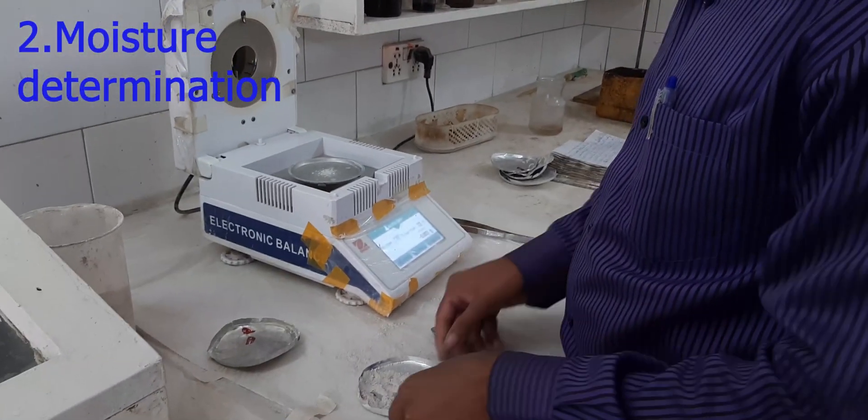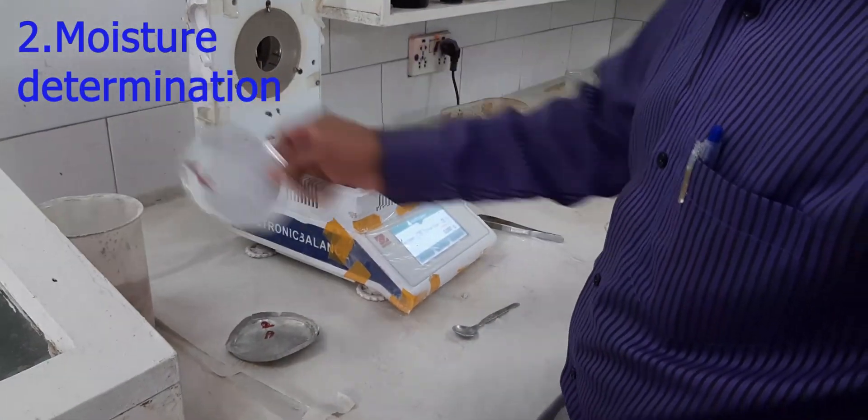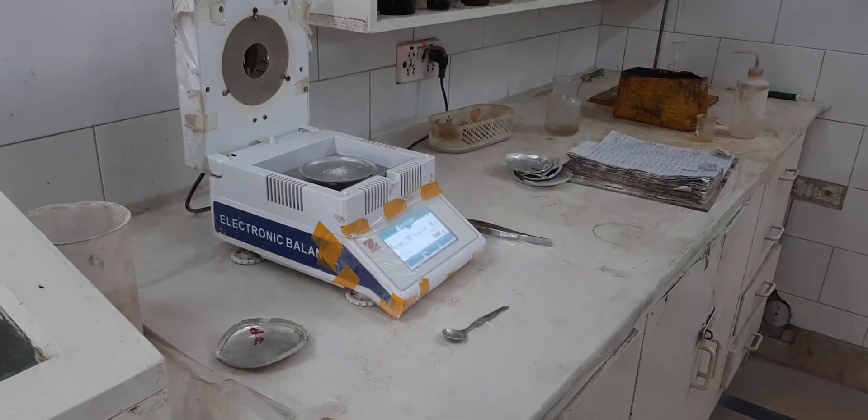Now we will check its moisture in a moisture analyzer.